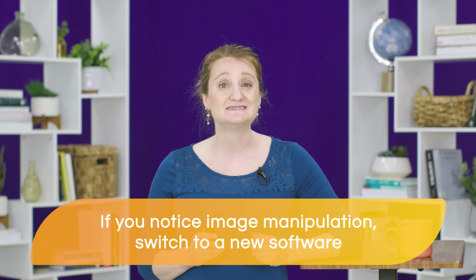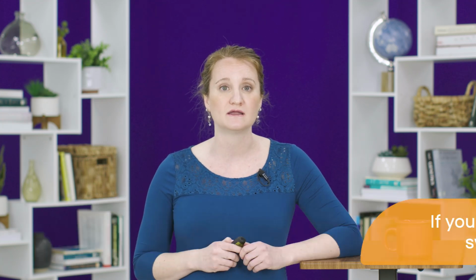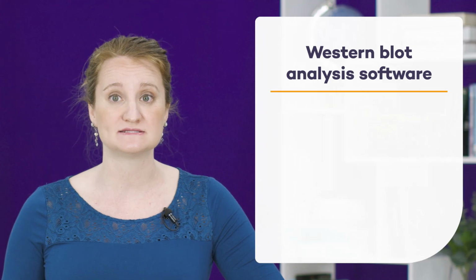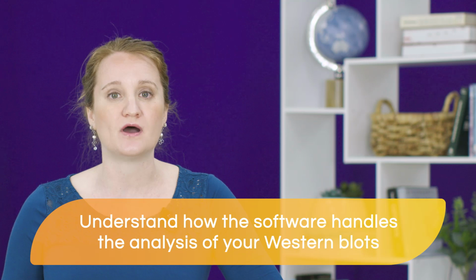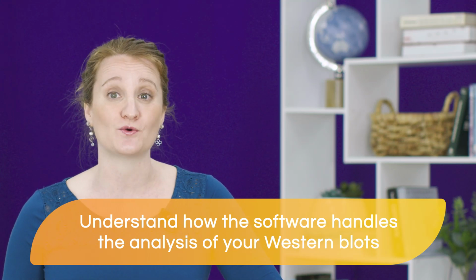If you notice that the software that you're using does manipulate your image, you should definitely switch to a new type of analysis software, one that is specifically designed for Western blot analysis. There are several different types of software packages that will allow you to analyze your data. For example, LI-COR has two different analysis software for your Western blots, Image Studio and Empiria Studio. Because not all analysis software is designed for Westerns or can allow you to make changes that can distort your data, it's really important that you understand how the software handles the analysis of your Western blots. Next, we're going to discuss how to handle the analysis of your saturated bands on your Western blot.